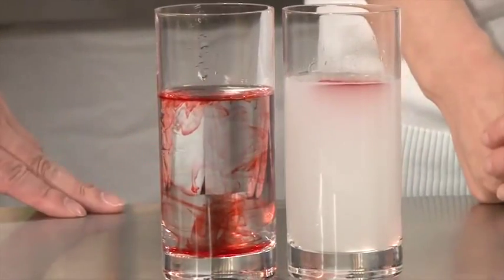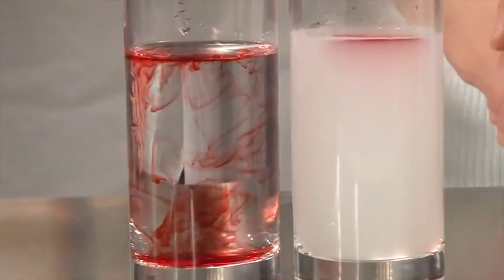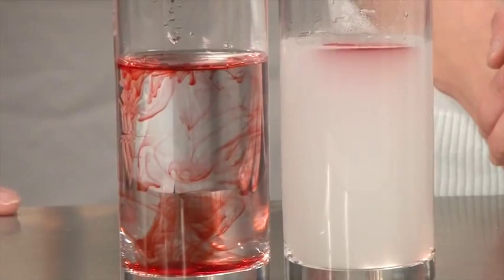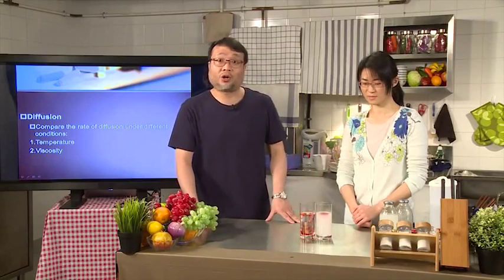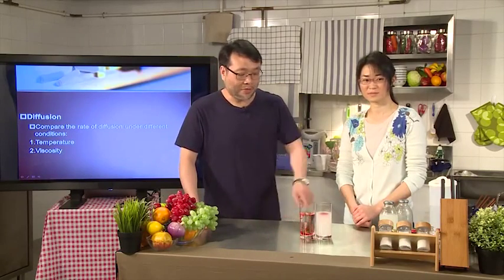So this is a very viscous starch solution. And you'll find that the dye is on the top. It is not moving at all. Basically, they have a hard time diffusing over distance. Let me remind you, in fact, diffusion still occurs, but it's much, much more slowly. If we stay here for long enough, you'll find that the dye would start to go into the solution. But then it will never be at the rate as fast as the one in the water.